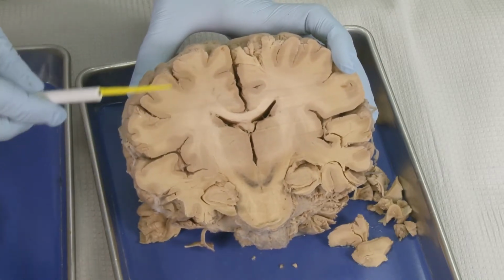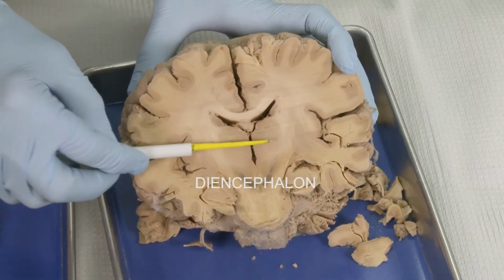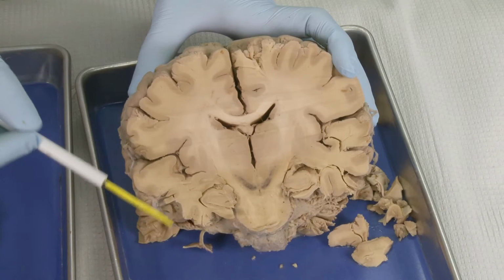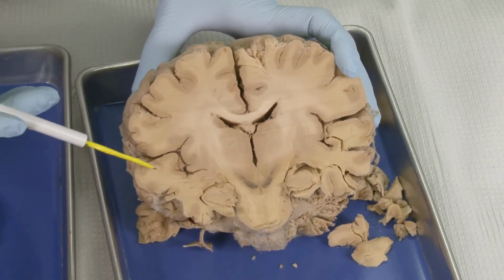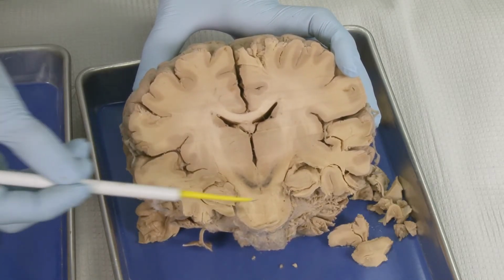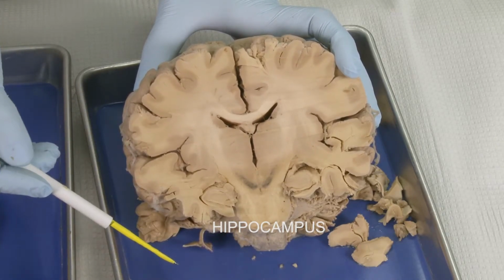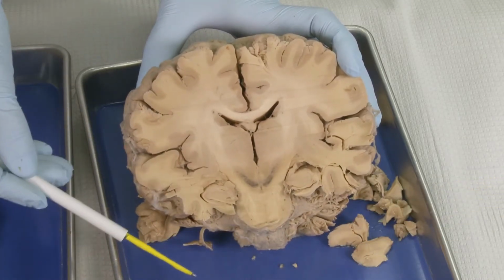and again, this is the level of sectioning through the diencephalon. That means that we have passed the basal ganglia, and now we are in the diencephalon and more caudal sections. In the previous section I showed you the hippocampus, but it was not really well distinguished. Here we can see the hippocampus very well. The hippocampus is the structure which is sitting in the temporal lobe. This is the temporal lobe of the cortex, and it is important for memory.